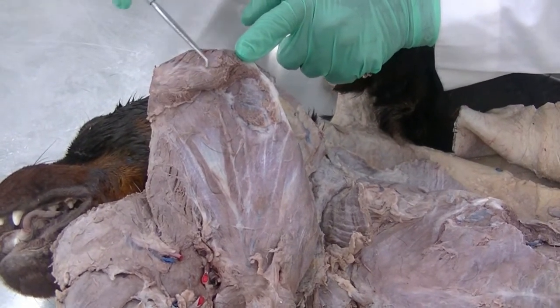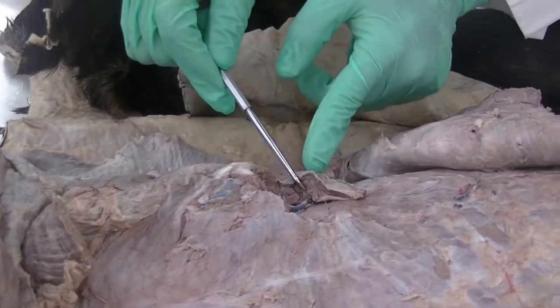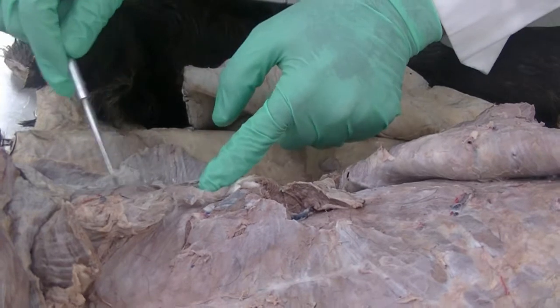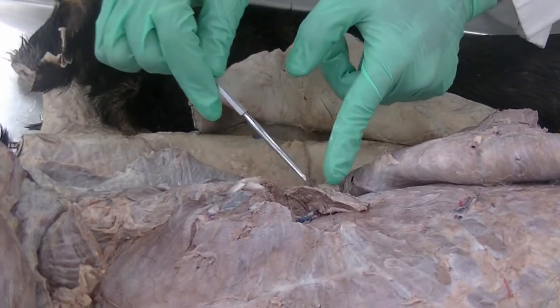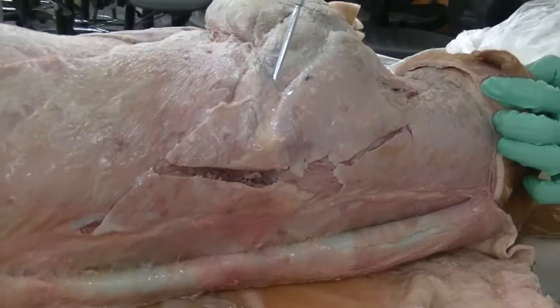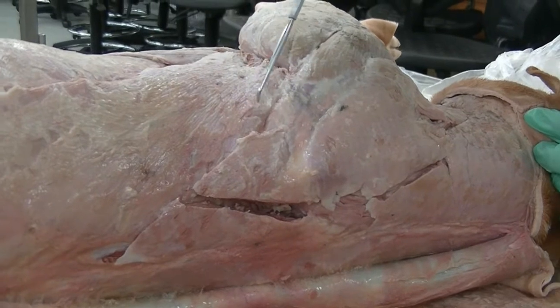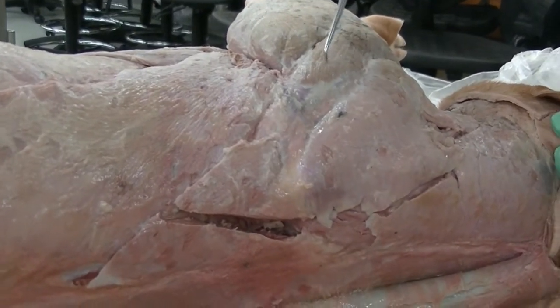That is the cut portion of the rhomboideus muscle, which is another extrinsic muscle, and we can see remaining part of the rhomboideus, the thoracic portion as well as cervical portion and the capitis portion, still attached to the trunk of the animal. Okay, we're looking at the same extrinsic muscles but on another dog, so we can just use it as a comparison between two different specimens.